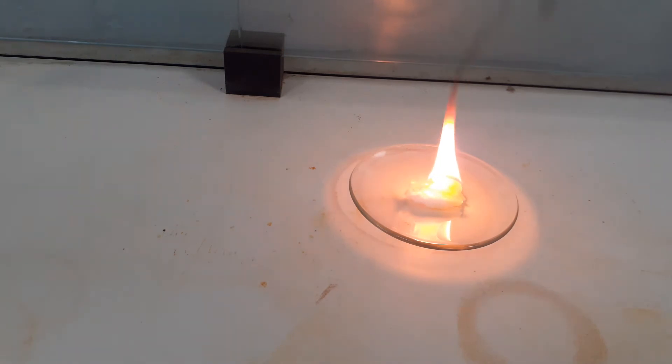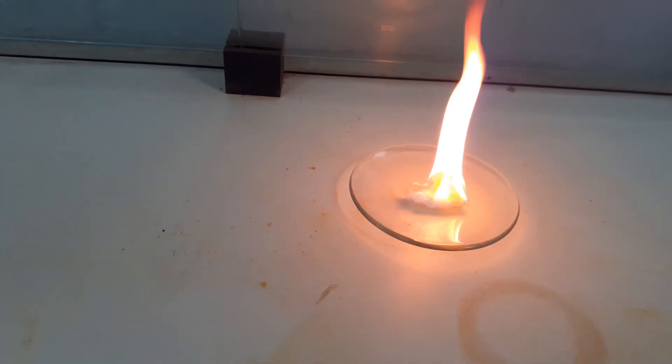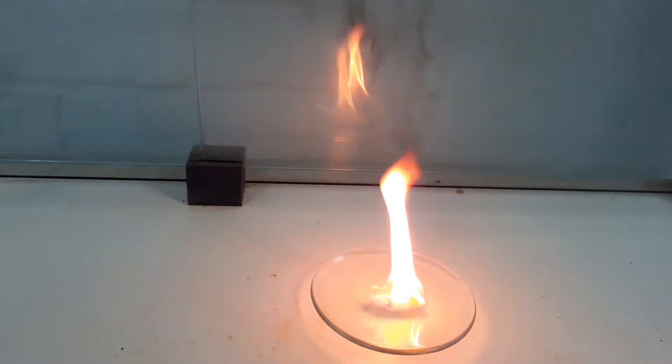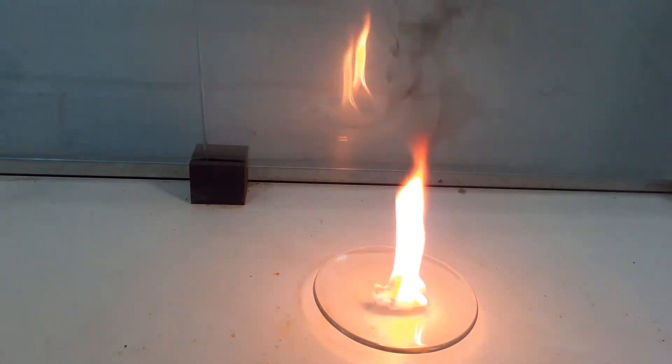As you can see again it's harder to light because these molecules are larger and longer, so there's a much greater ignition temperature. As you can see already the flame is much more orange, there's a lot of smoke being produced. I'll just move this so we can see how much. So certainly not a fuel we would tend to use for burning in the homes.